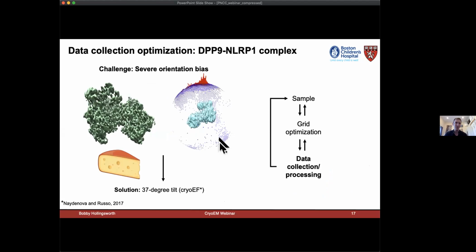And so we had DPP9 situating on the grids in this particular orientation where we weren't getting these top or bottom views. And so that leads to some really big issues with the EM density itself, where the density is anisotropic. It appears almost visibly perforated with holes, like Swiss cheese, and the density is all stretchy. And so it's impossible to build a model from this. And so we had to turn to many different techniques. We tried different grid types, additives, and what ended up working for us was essentially brute-forcing this problem by tilting the stage to distribute these orientations over a new cone.